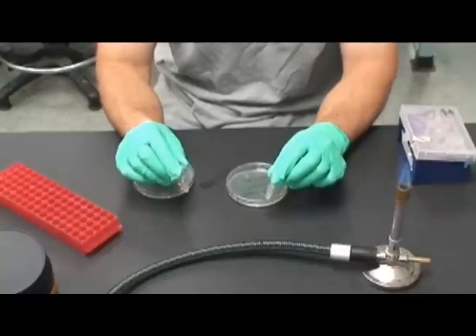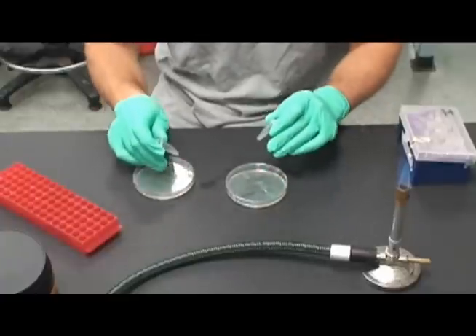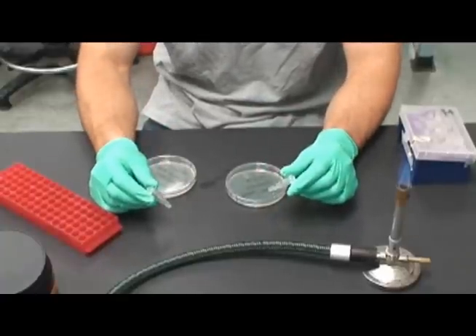Incubate overnight, and the next day, count the colonies on the plate to determine the efficiency of the transformation.